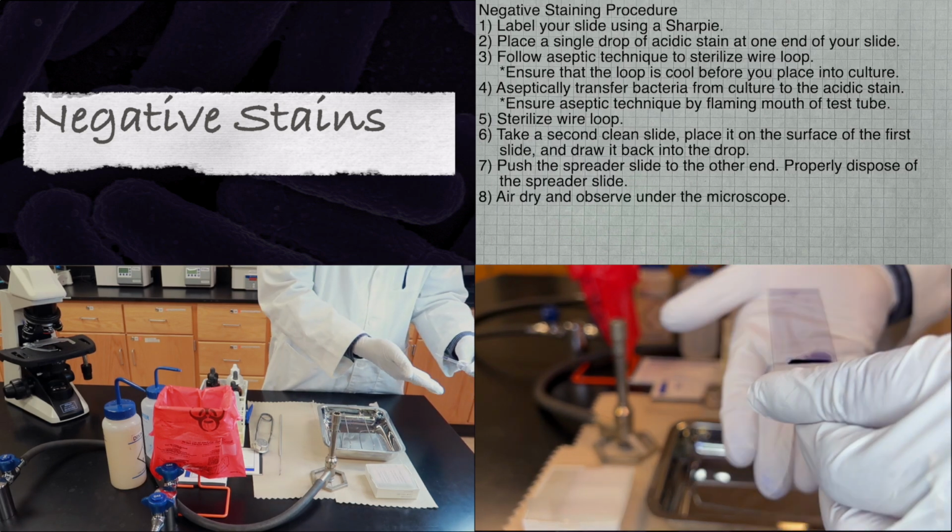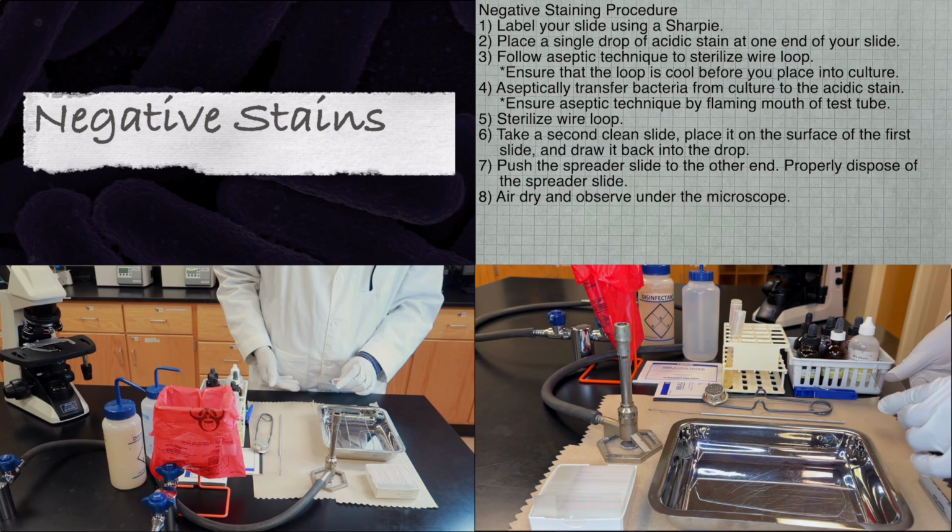Finally, allow your slide to air dry and then observe underneath the microscope.